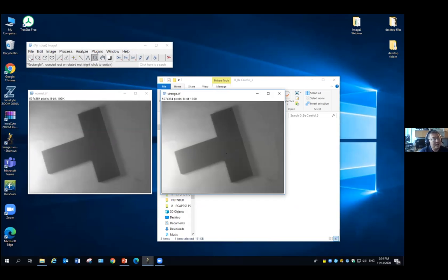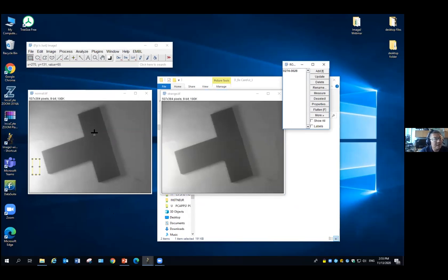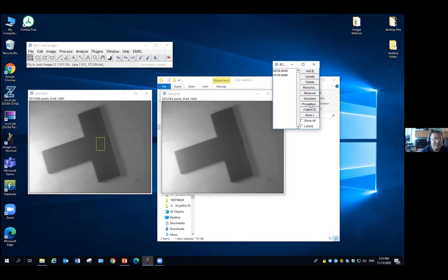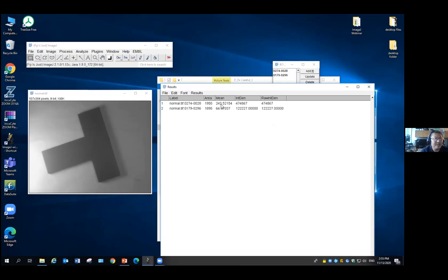So now what I'm going to do is set an ROI in the bright region. I add it to the ROI manager. Then I also draw another one in the black region, in the T shape here. So in the normal one, let's say I measure it. As you can see, the mean intensity of the first one, in the bright region, is 243. The black region is about 64. That's normal. This is bright, this is dark.